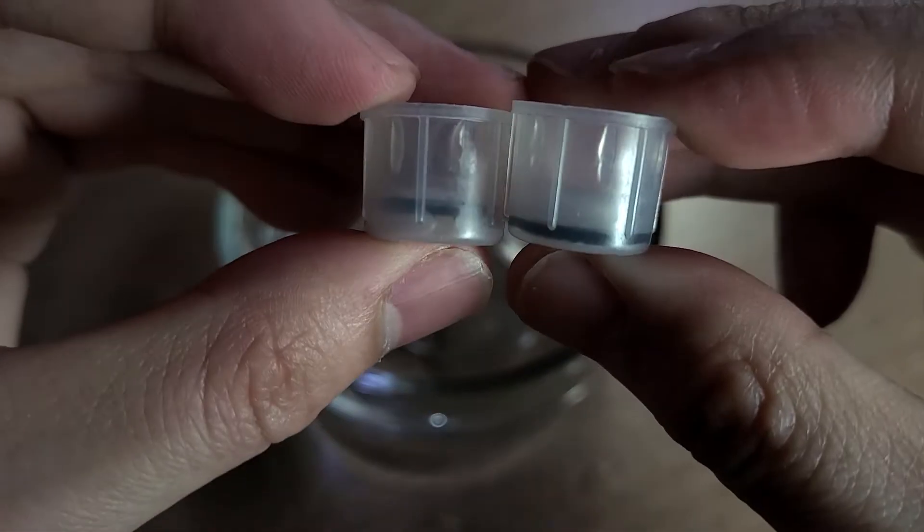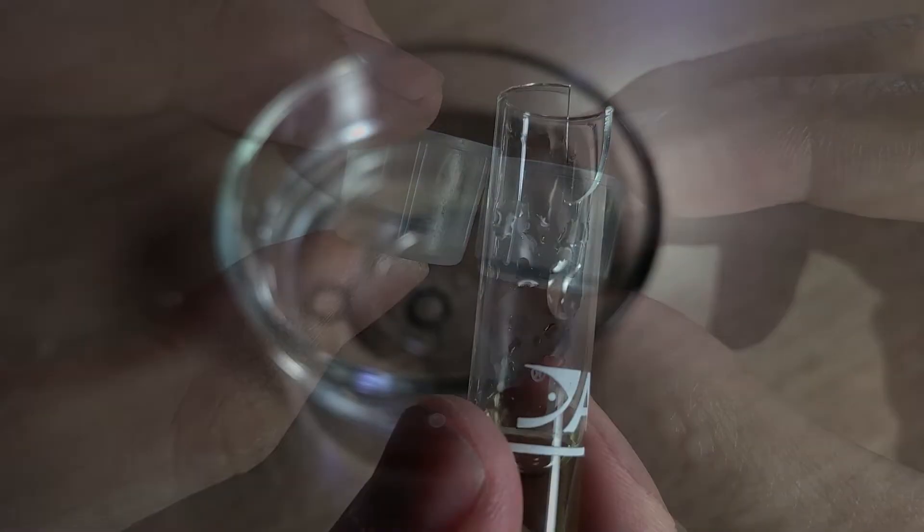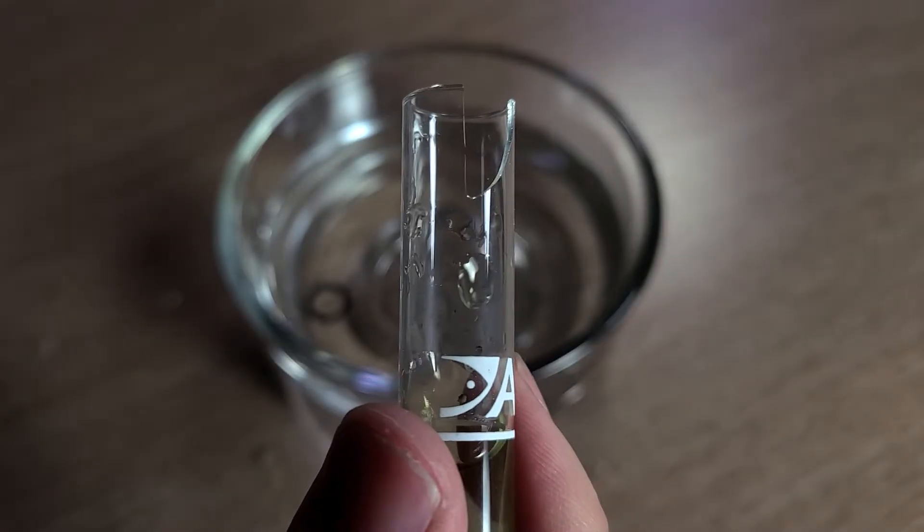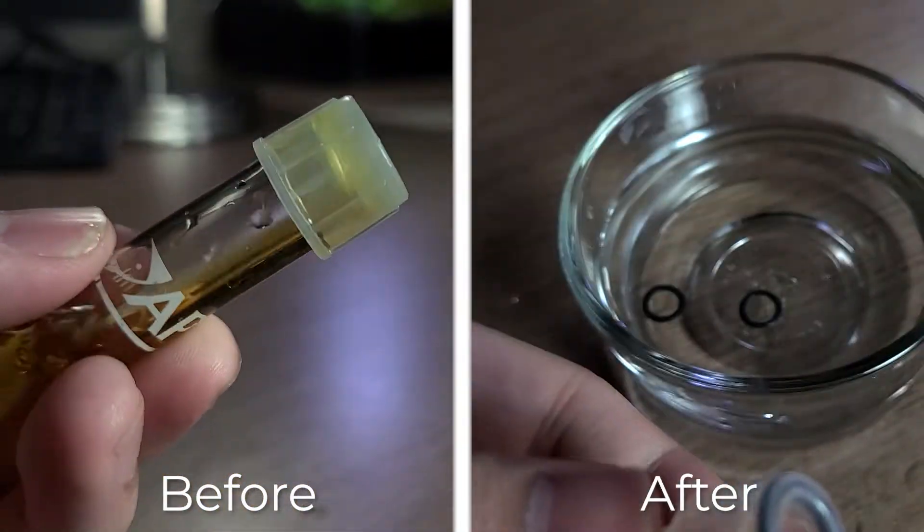Please make sure that the O-ring is completely at the bottom of the cap, or you may end up breaking the tube just like I did. The O-ring will prevent any leaks from happening.